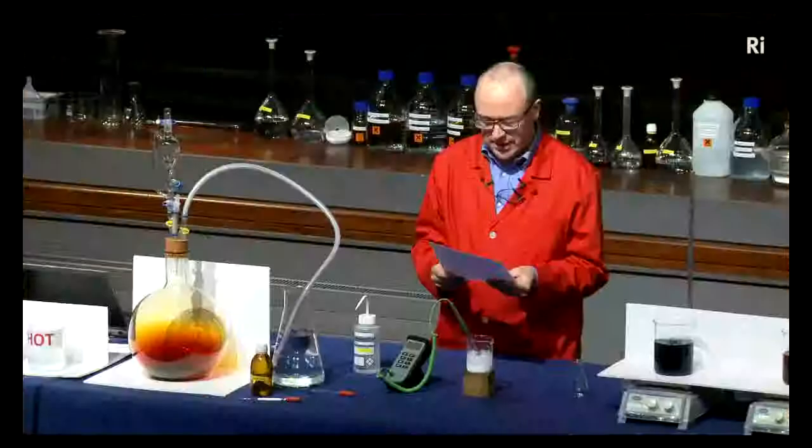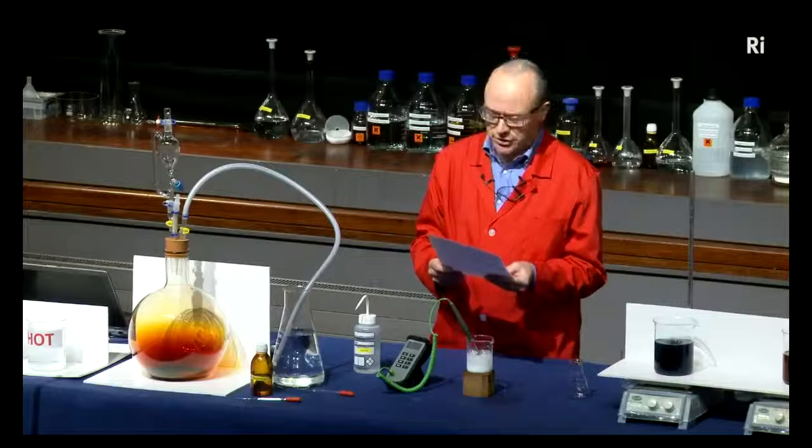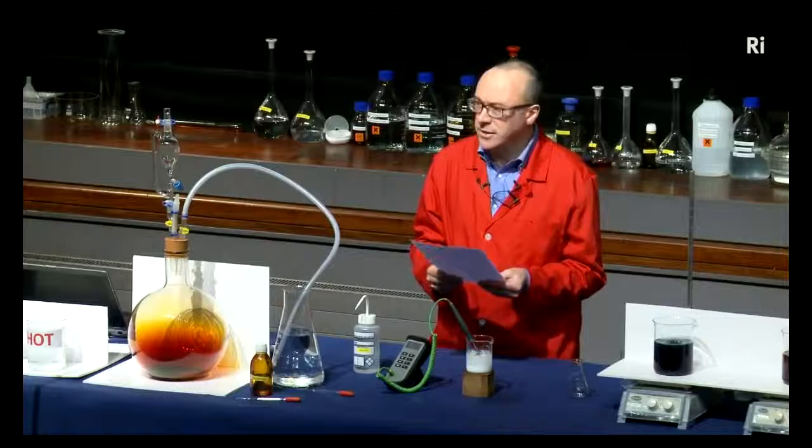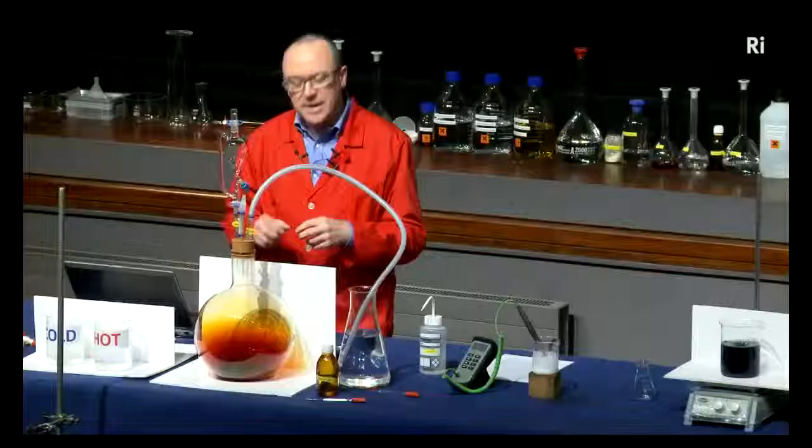It was a revelation to me. It resulted in a desire on my part to learn more about that remarkable kind of action. Plainly, the only way to learn about it was to see its results, to experiment, to work in a laboratory. So that's the reaction of nitric acid with copper, and it's produced these dark brown fumes which are called nitrogen dioxide — they are actually pretty unpleasant, which is why we're doing this in a sealed apparatus.